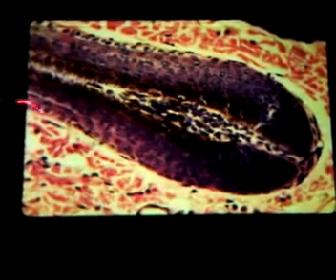Higher magnification view. Again, we have stratified squamous epithelium. There's the hair root and the bulb system. This is a little bit of smooth muscle for the erector pili muscle. This is your connective tissue, which will be dense irregular connective tissue. And now you can see melanin in the upper cells. The melanin will go into the cells or beyond the cells, which are going to be pigmenting your hair. So this one's going to be a dark-haired individual who this section came from.